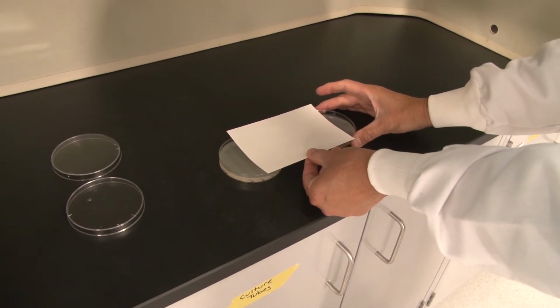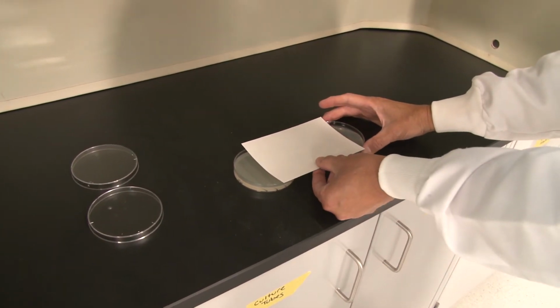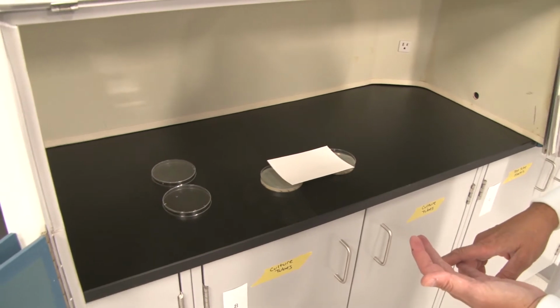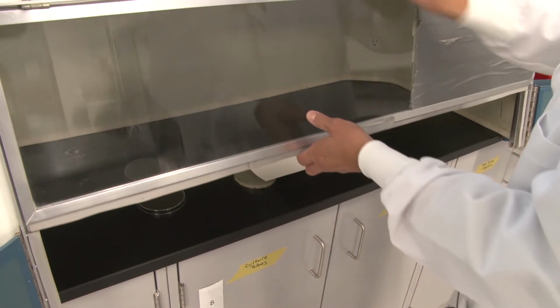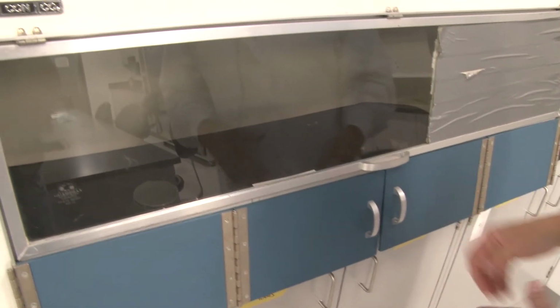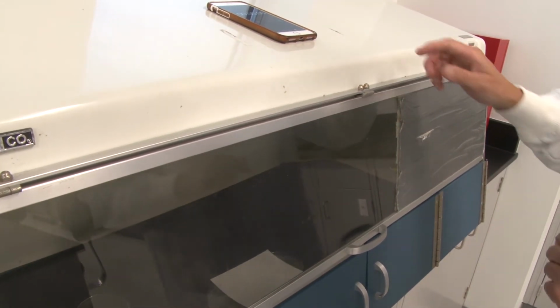All right, so we did our 30 seconds, actually a little over. I see I went 34 seconds because I was talking. I'm going to spread the plates apart, and now I've exposed the 60-second and the 30-second region. At this point, we are going to just do 10 seconds of exposure, and that'll make it 40-second exposure to the 60-second realm and 10-second to the 30. Not what we want, but we will get there.